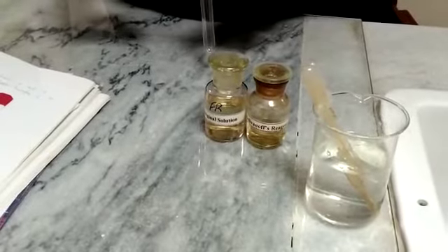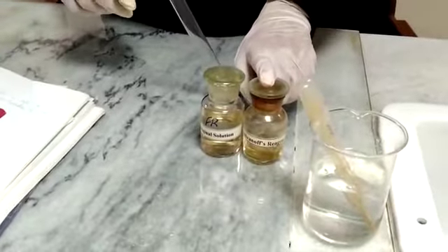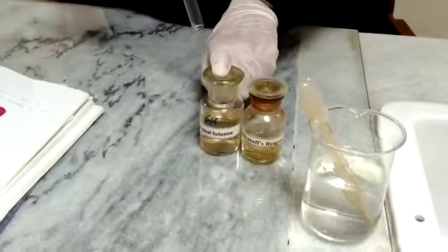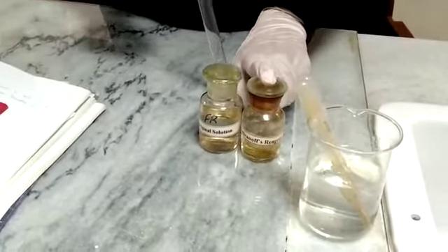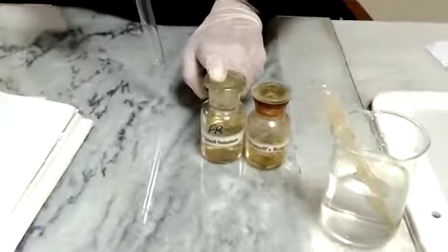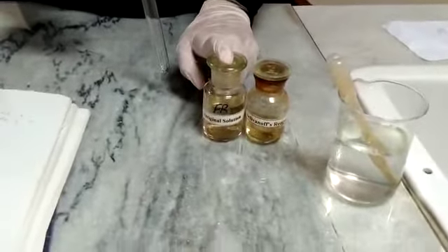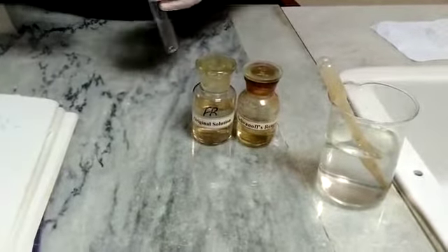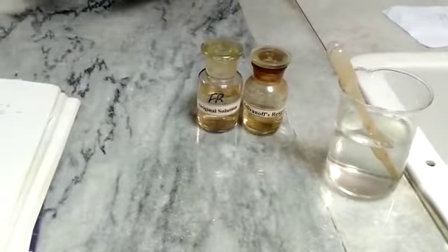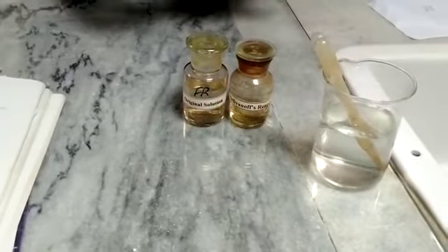For that purpose, we are going to use the Seliwanoff's reagent and original solution. We will take 5 ml of Seliwanoff's reagent into a test tube, add about 5 to 6 drops of original solution into it, heat it on a direct flame, and observe the color change.